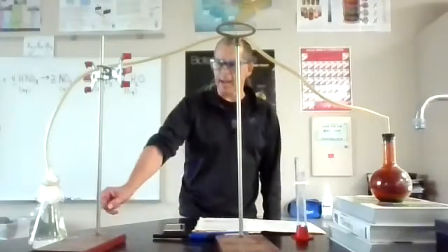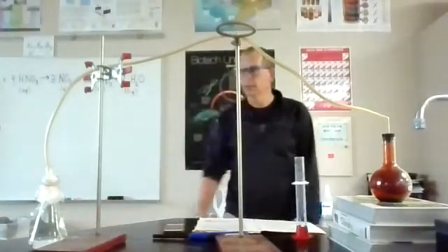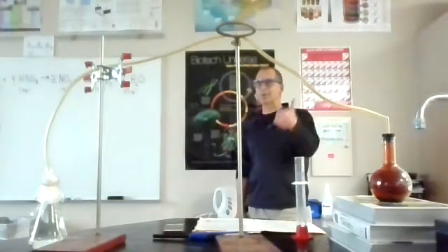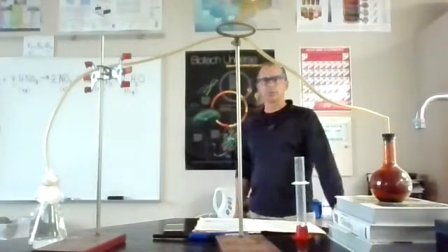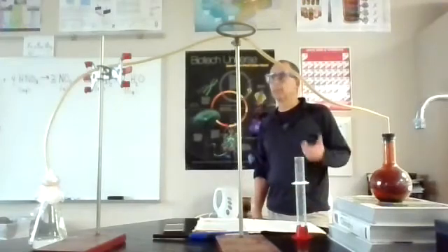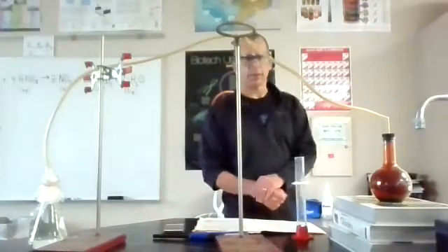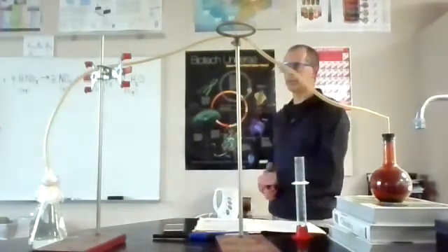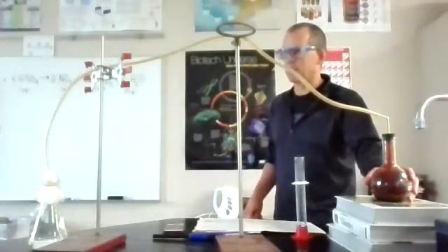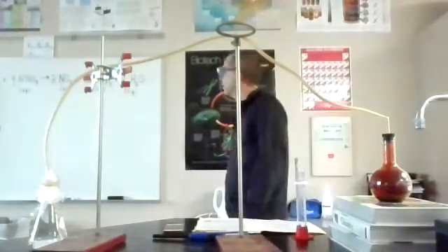Now notice what happened here is that this turned clear. It was a base, but now it's turning clear. So maybe this reddish gas might be acidic, because it's making the phenolphthalein turn from pink back to clear and tending to neutralize that out. Okay, I could look at an equation. It looks like it's still bubbling through right there and definitely getting warmer right now. So I can feel that.